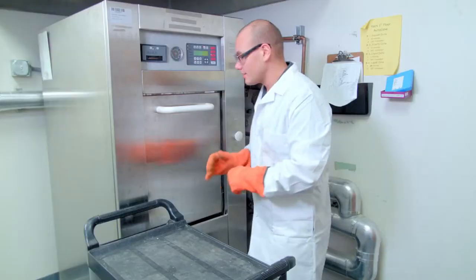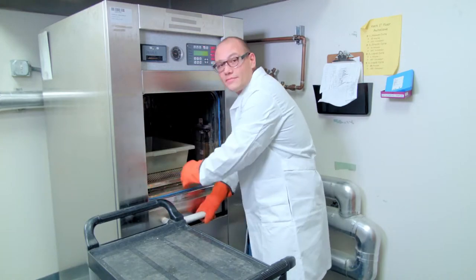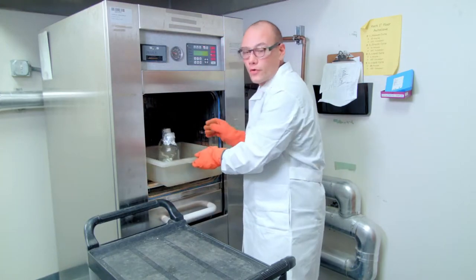Be very careful when you're removing materials from inside of the autoclave. Liquids may become superheated and may boil over when disturbed.